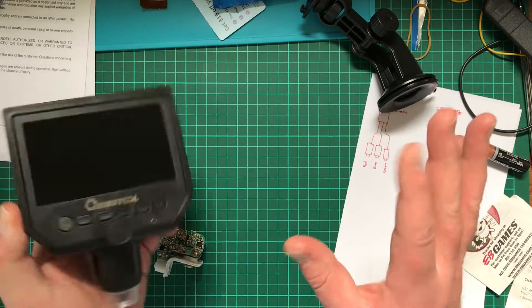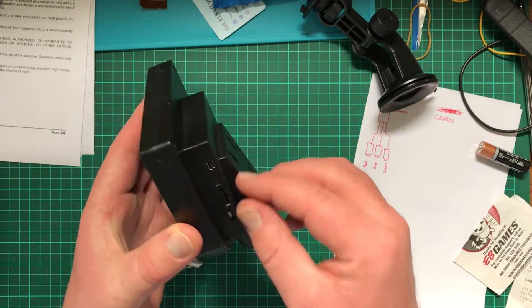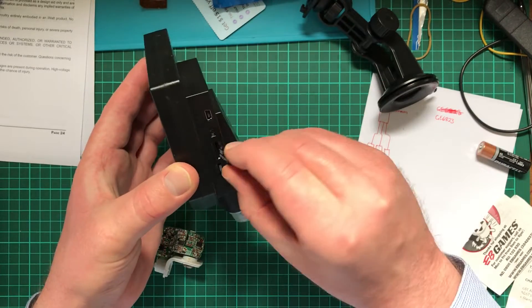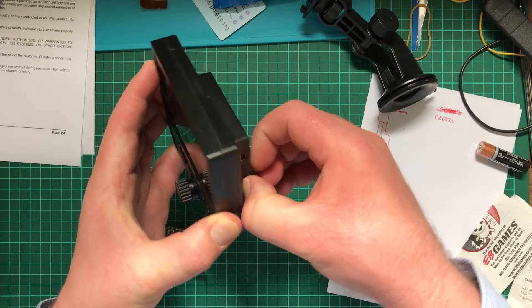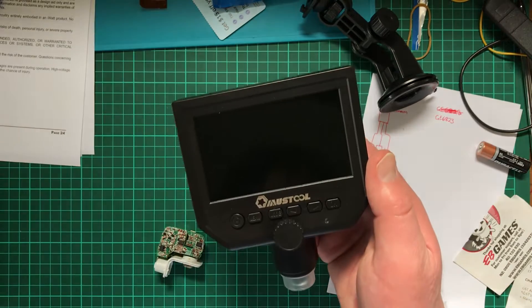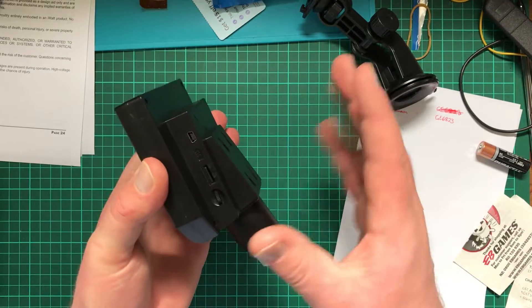By the way, I've got a new recording device. Really hope it's better than the other one. So what I ended up doing was taking this little bit dodgy SD card. So far I've been finding it okay. I did notice when it does crash, just get something and poke it in there with that reset switch and the whole thing just reboots and it's fine. So if you do put an SD card in there and it's got a bit of corruption — yeah.